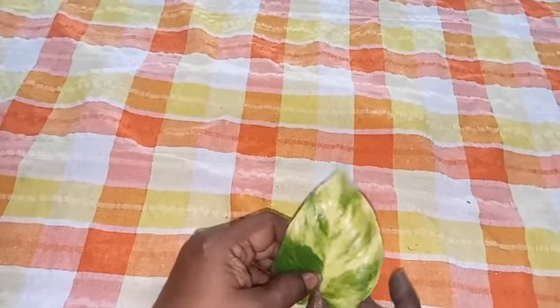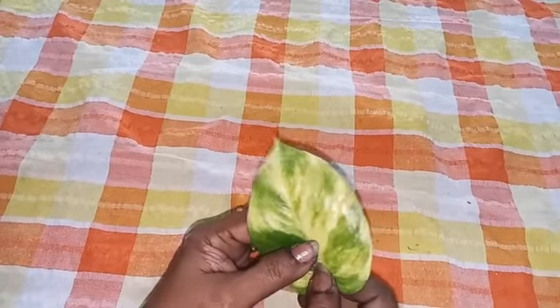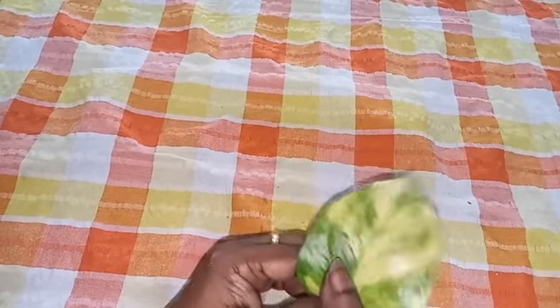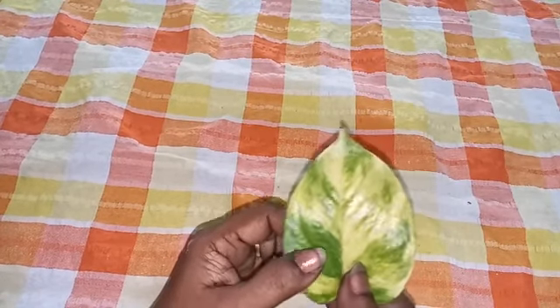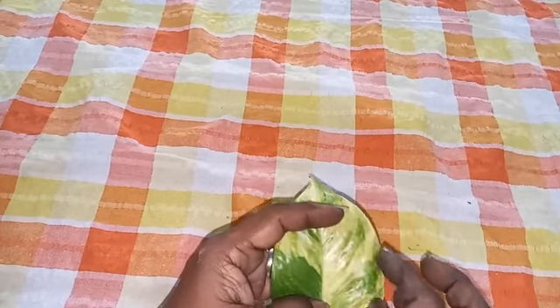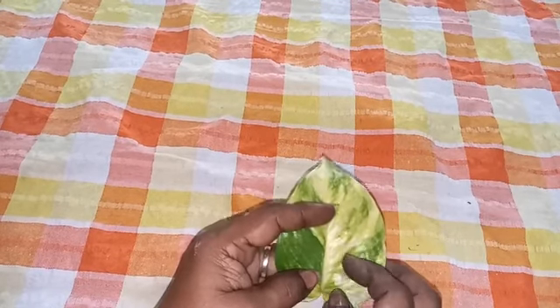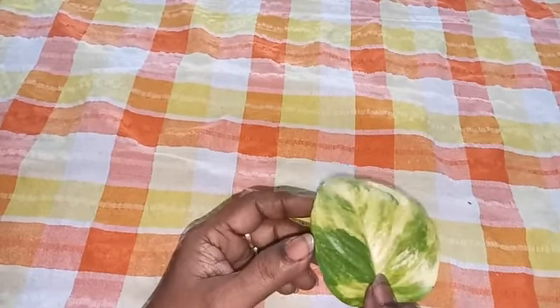Now we are going to conduct an experiment to prove that chlorophyll is necessary for photosynthesis. This leaf has green and yellow patches, the pattern itself is like that. Chloroplast and chromoplast, all plastids you have studied. We have to keep the leaf on a paper and mark the region where it has green color. Green color shows the presence of chlorophyll. Okay, after this we have to do the starch test.